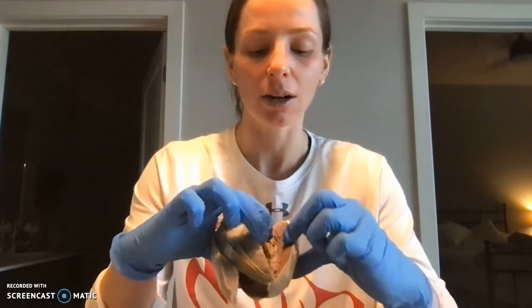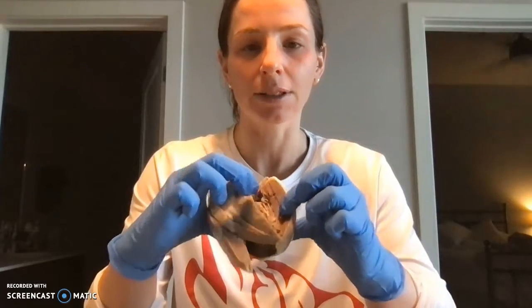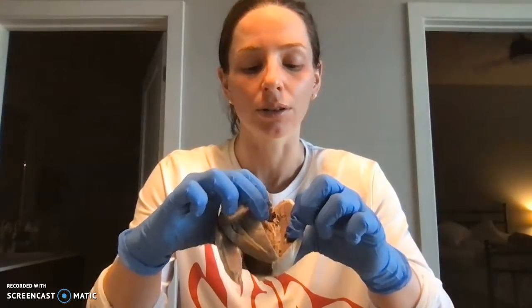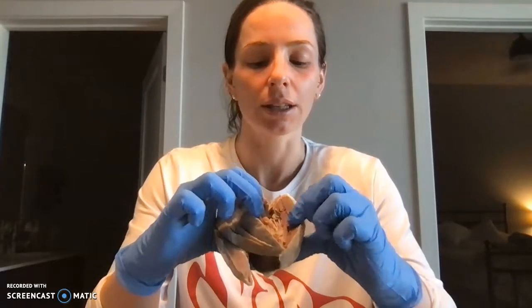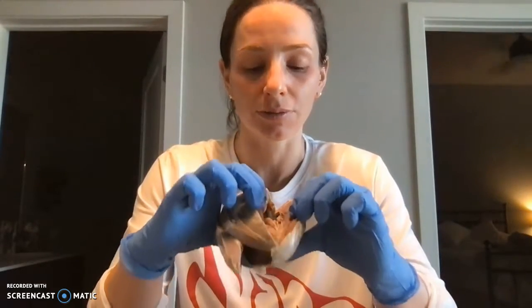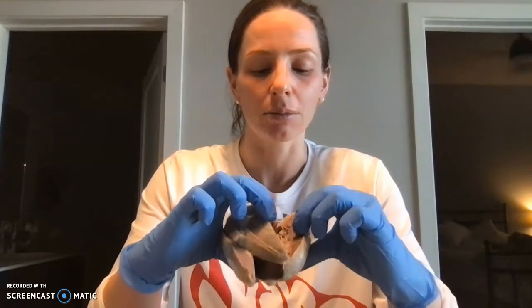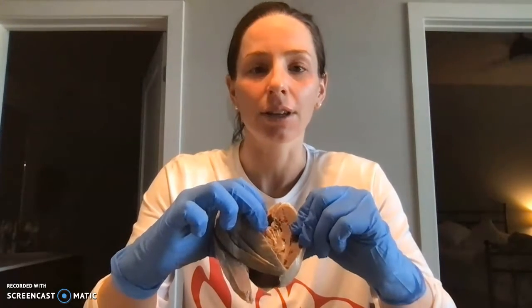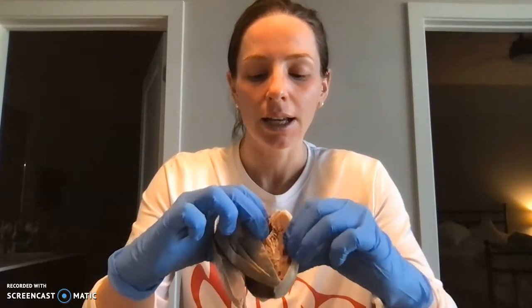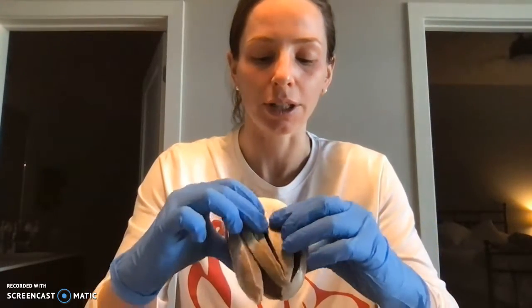And you can see the thick walls of this left-sided ventricle. So this is the myocardium, the cardiac muscle. We know that this muscle can succumb to hypertrophy, so it gets larger than it should, and that can be dangerous in some aspects. But we also know that athletes commonly have a thicker muscle wall on this side because the blood is pumping out to the body from the left ventricle here.